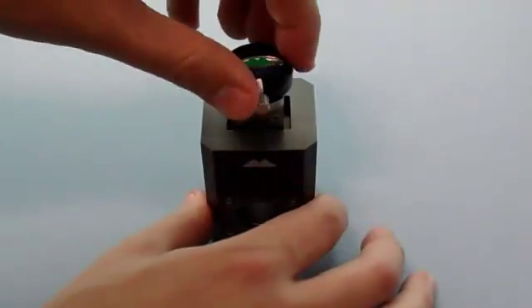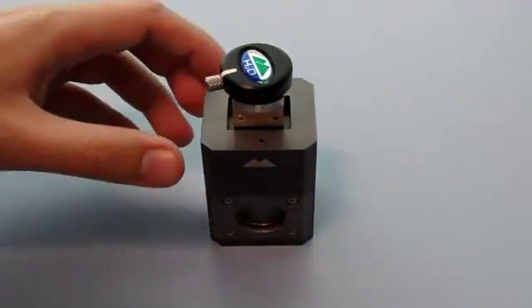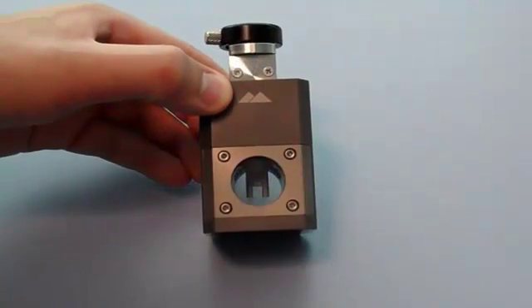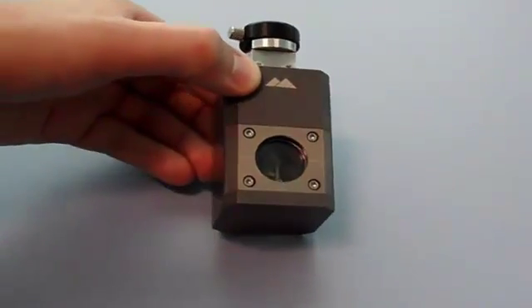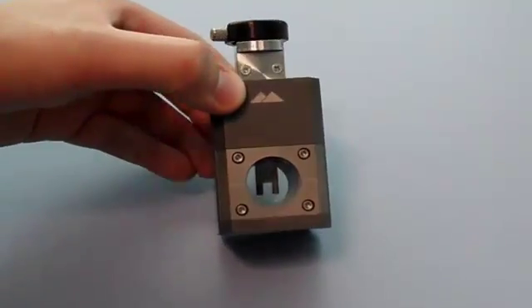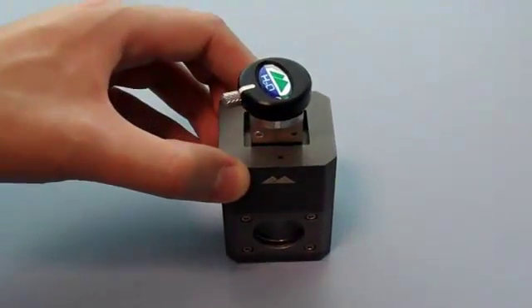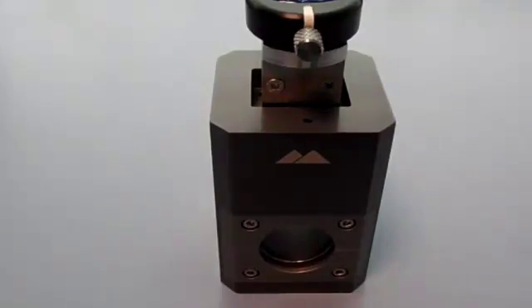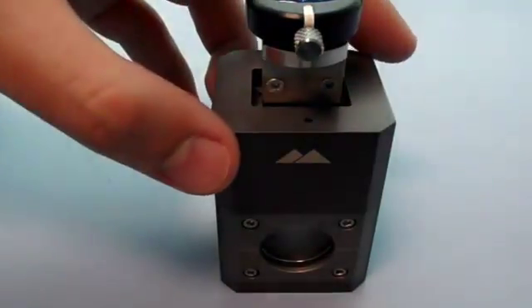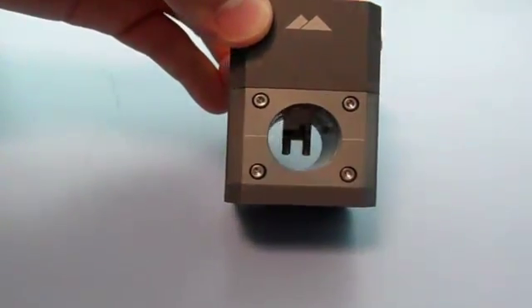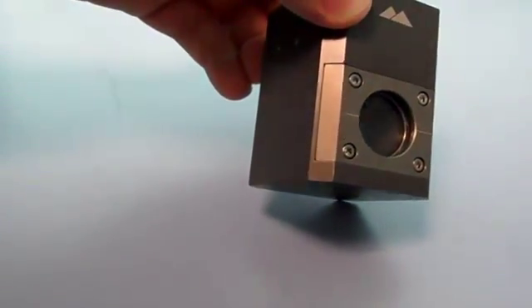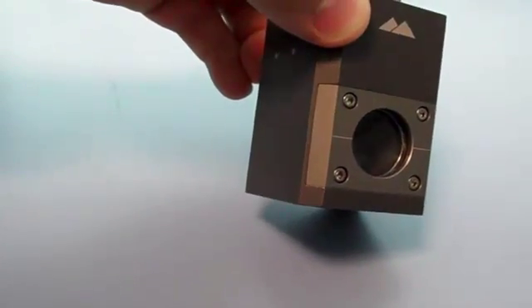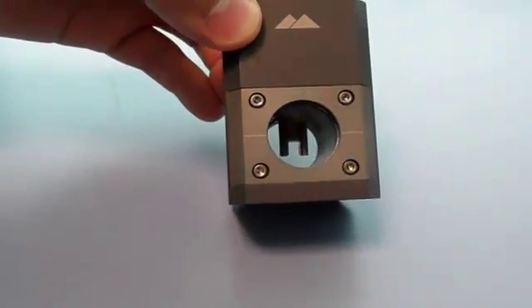By rotating the cell cap, the cell height can be moved up or down. Rotating the cell cap clockwise will lower the sample and mask the laser. Rotating the cell cap anti-clockwise will raise the sample and reveal the laser. Hold the alignment tool containing the cell at eye level and look through the front and back glass targeting reticules. By rotating the cell cap to move the sample up and down, align the sample so that the sample surface is in line with the centre of the glass targeting reticules.